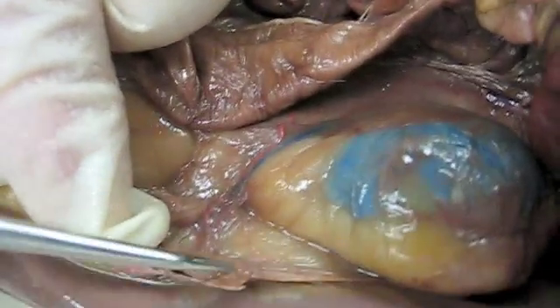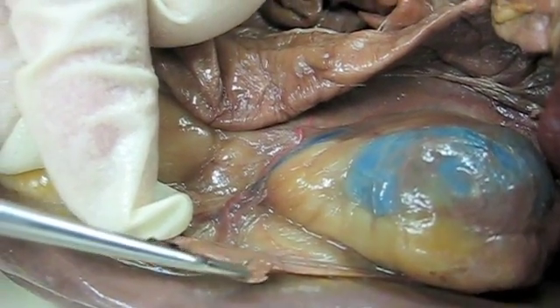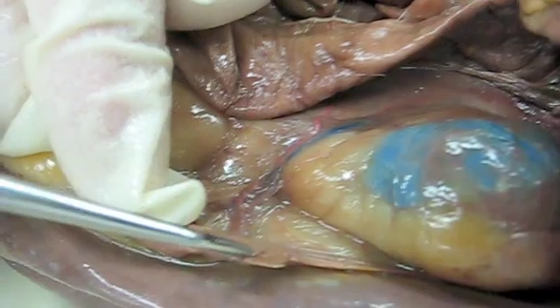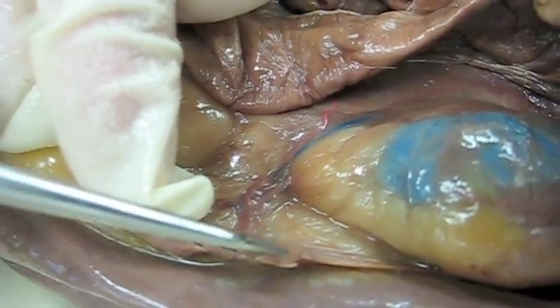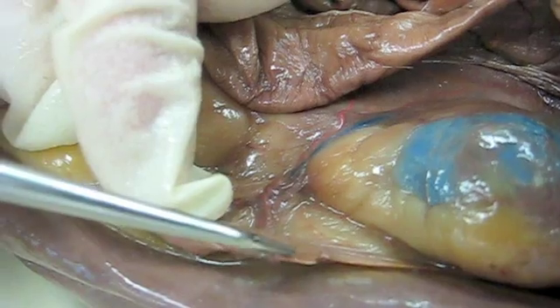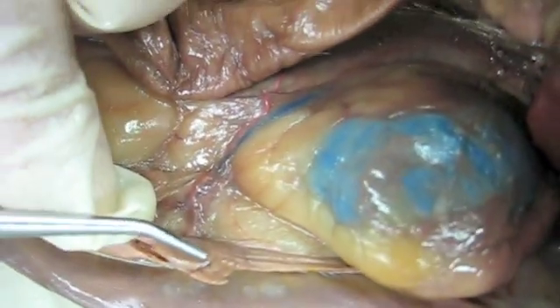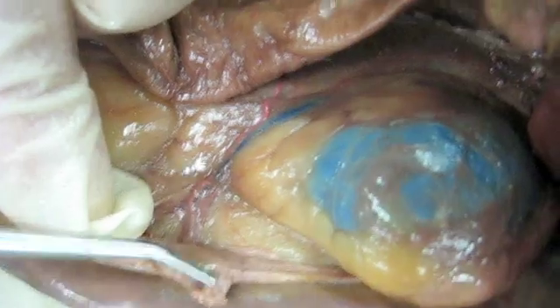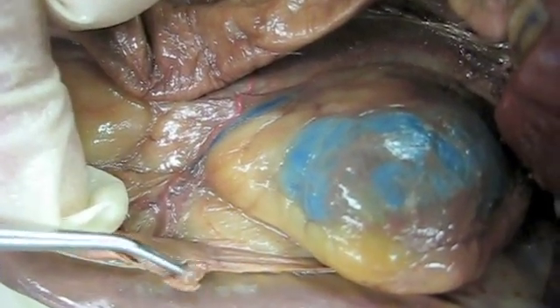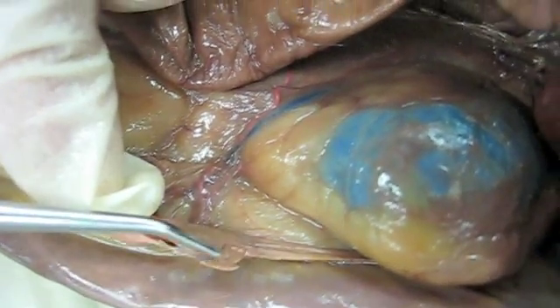Up in here, this expanded end of the oviduct would be the infundibulum, which is this whole area. You can't see the little finger-like fimbria that come off the infundibulum, and I can't get my probe into the ostium, which would be just the opening here into the infundibulum.